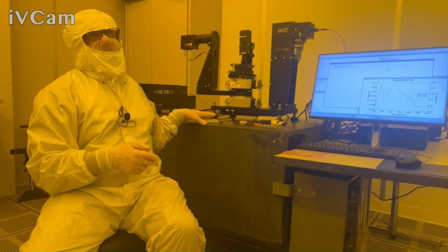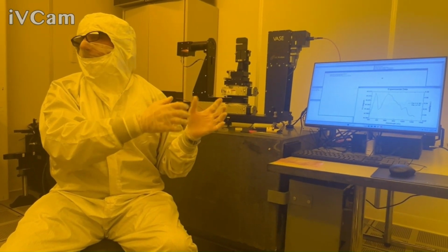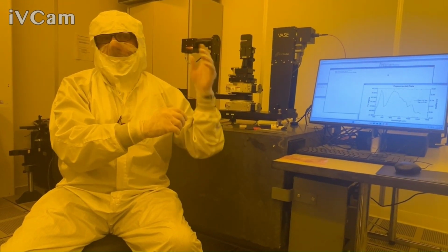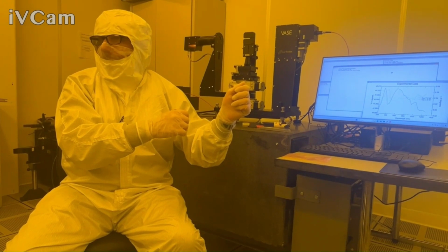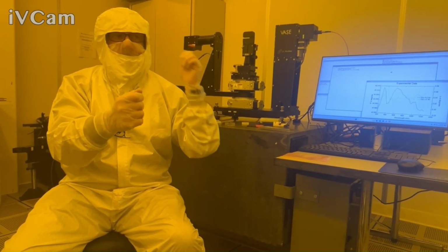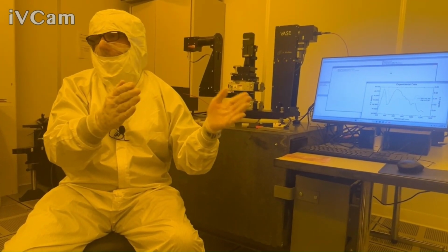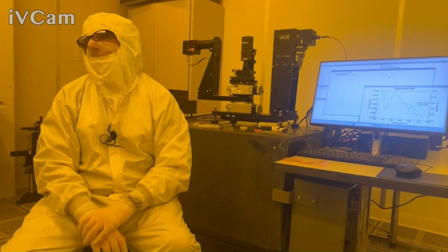Technically, what I would probably do is I would do 2 scans. If you're going to target a certain sample, it's going to be very similar; your samples are usually going to look like this sample. I do a very, very detailed measurement to see what's the best you could do. And then I do the faster measurements without those settings and see, can I get the same result if I do this and this? Yeah. And if I can't, is the difference well within what you're looking for, or is that a problem? Okay.